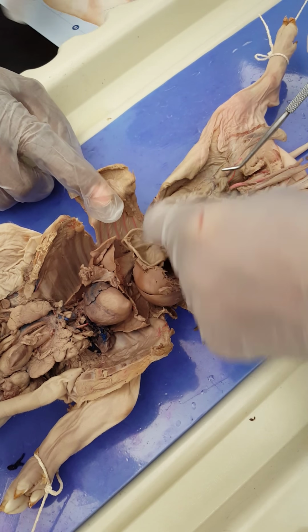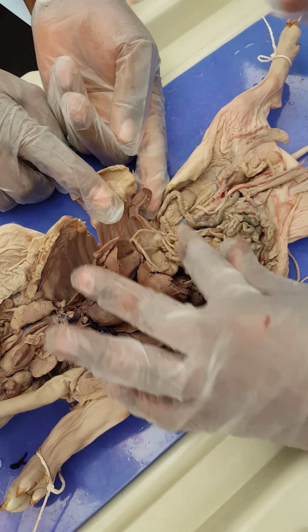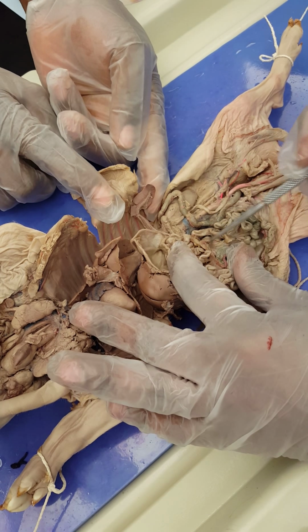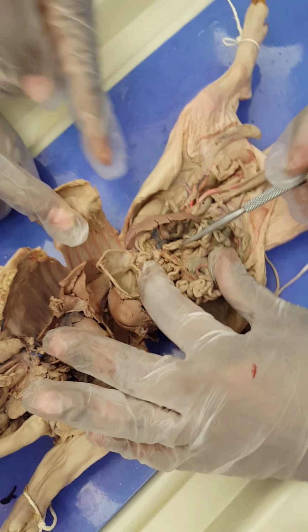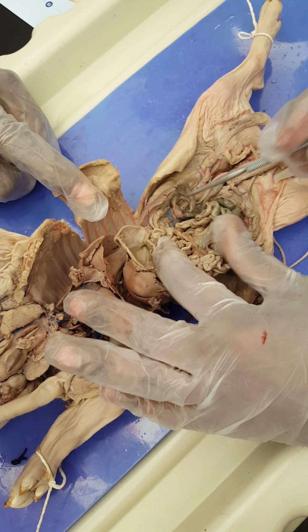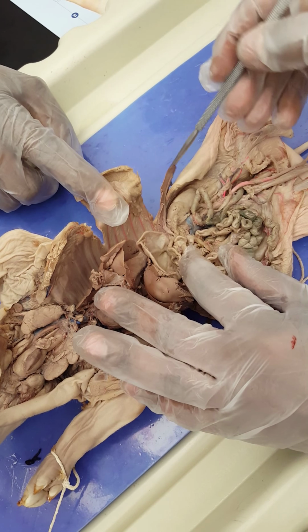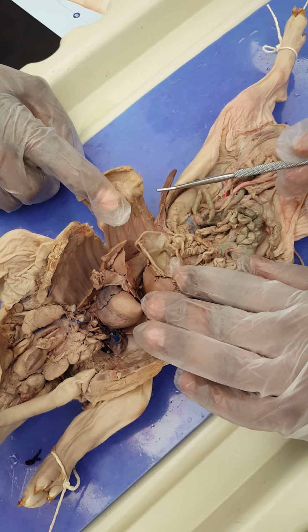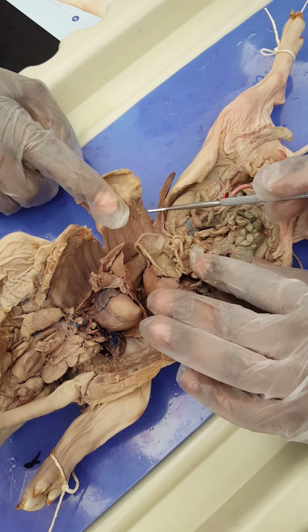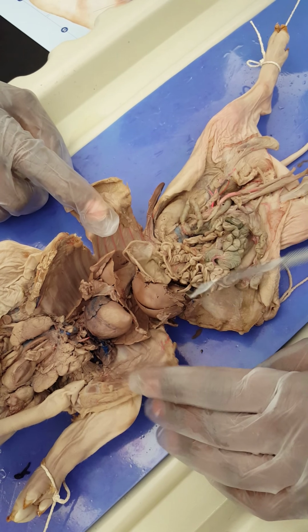We're not going to go into details, but I want to show the mesentery, which is here. This is the mesentery. All right. Mesentery. Okay. This guy here is the spleen. Yeah. This is the spleen. All right. And it's found on the left hypochondrium, whereas the liver is on the right hypochondrium.